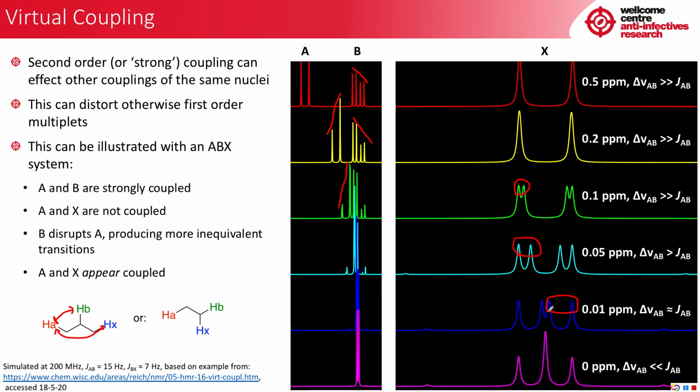And if we take this all the way to the extreme and make the chemical shifts of A and B identical, then the J value is obviously much larger than the chemical shift difference, and we end up with what looks like a triplet. And that's something you might alternatively expect to see from this system, where HA is coupling to an equivalent B and X. And it would be quite hard to distinguish these two.